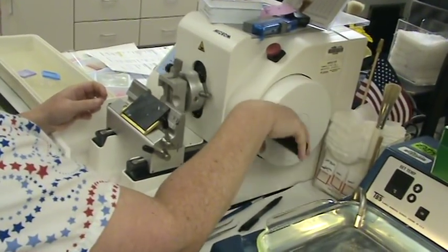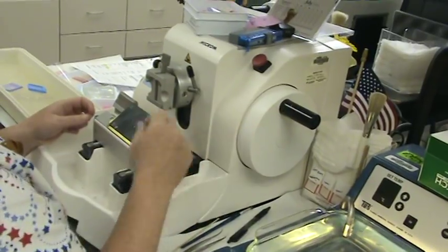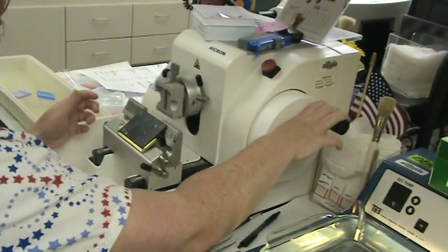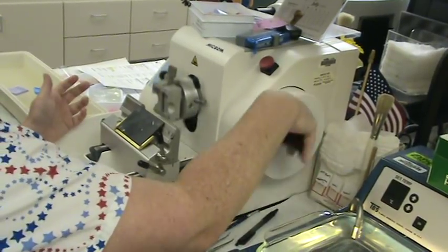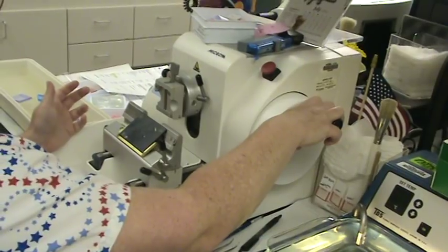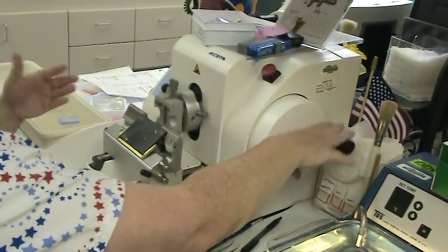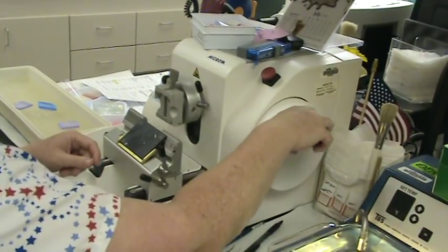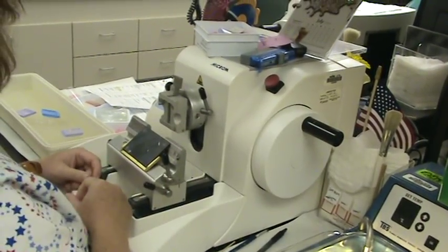About how many times an hour do you think you spin that wheel, if you can guess? Oh, well, I don't know. Kind of depends on how good a cut you get. Sometimes you have to do more on some, because you have to face it off first, and then you go back. And so it's probably... Or how many times per sample?